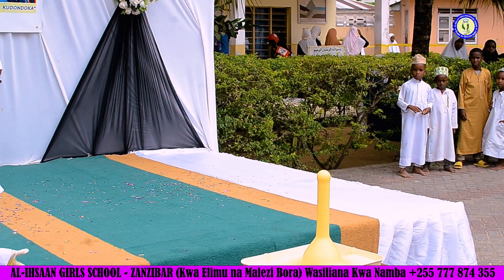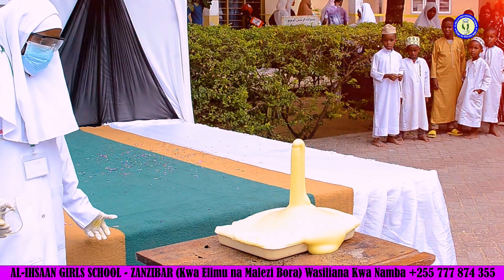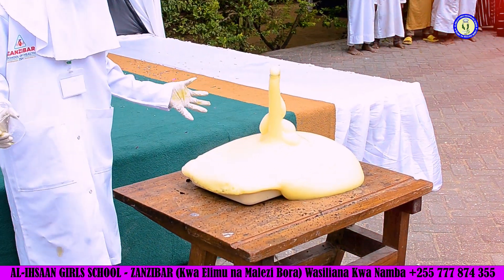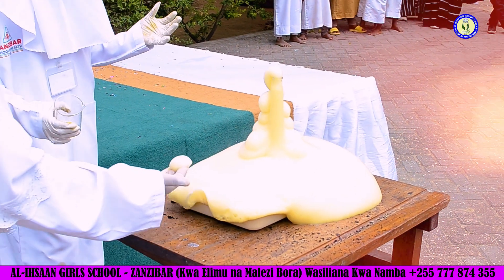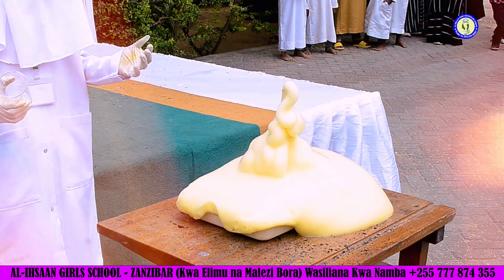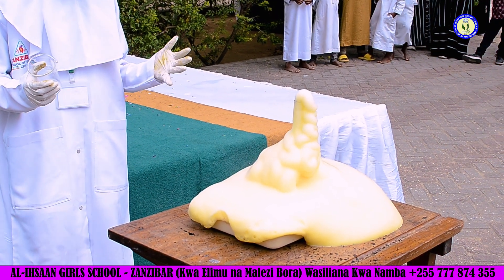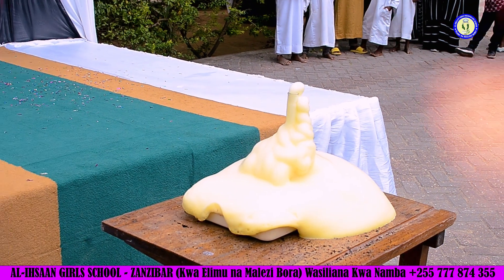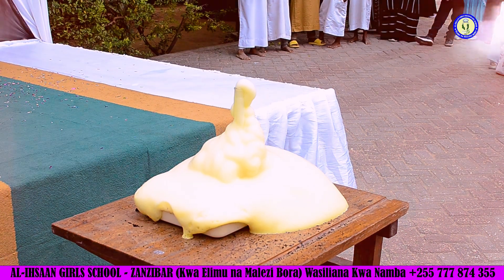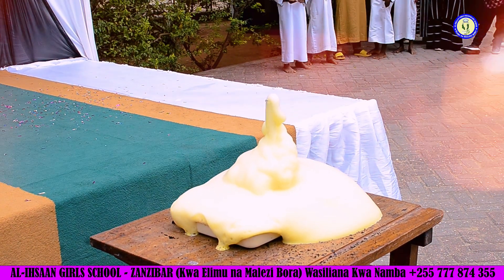And there it goes! This reaction shows the dynamics of chemical kinetics — the foam that you see represents the release of gases, and the color change that you witnessed is the formation of iodine molecules in the reaction. This reaction tells us that chemistry is not only about numbers and equations, but it is also about change — just as we have changed throughout our academic journey.